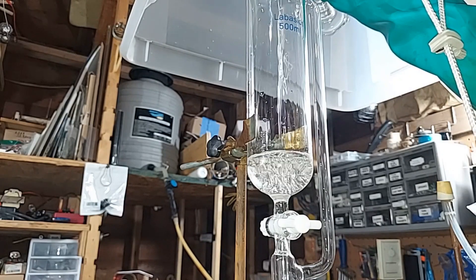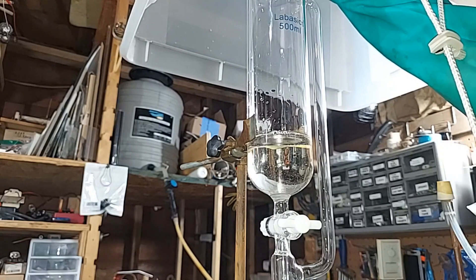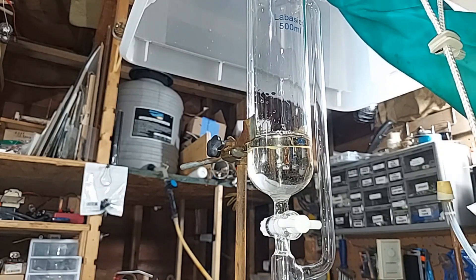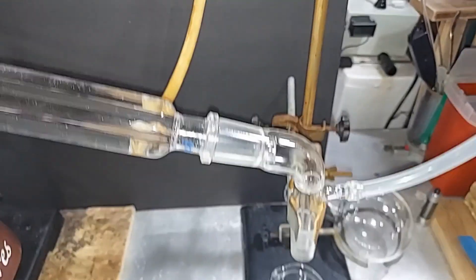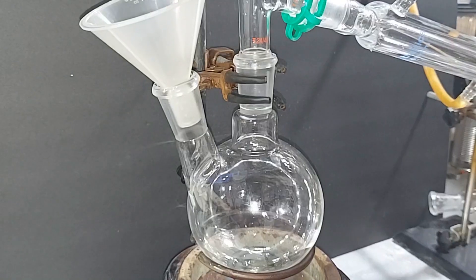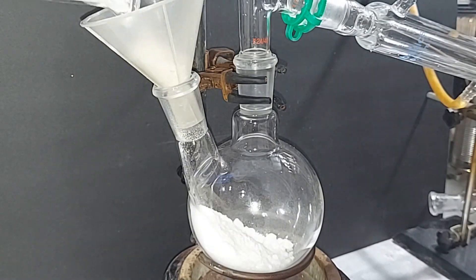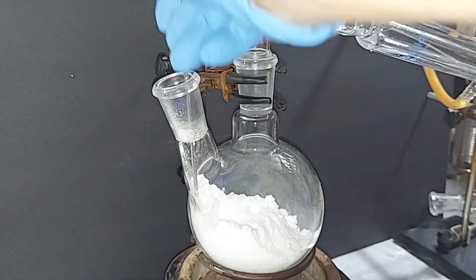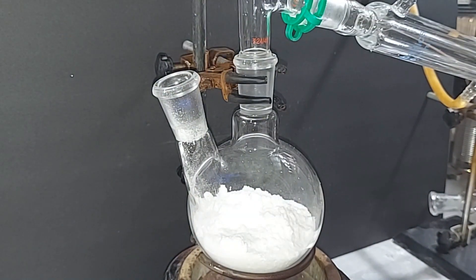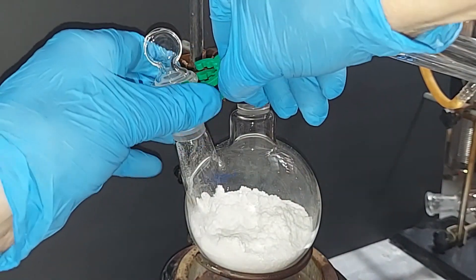The reason I'm adding the sulfuric acid first is that if there's a leak in the addition funnel, I don't want to find out after the anhydrous sodium acetate is already in the flask. The acetic acid coming over will produce fumes, so I added tubing at the outlet to route them up into the hood — it can be a bit irritating to the eyes and nose. Now adding the anhydrous sodium acetate and sealing the last piece with silicone lubricant.